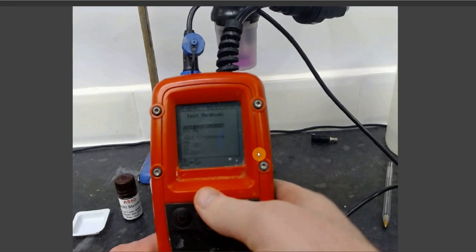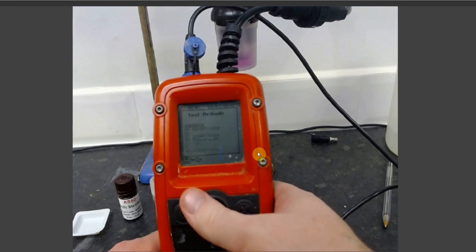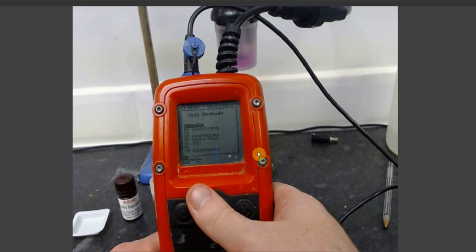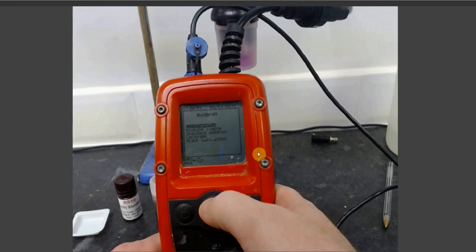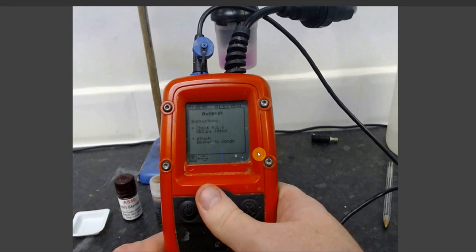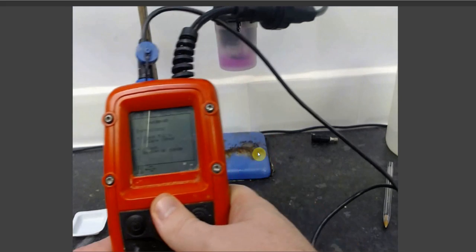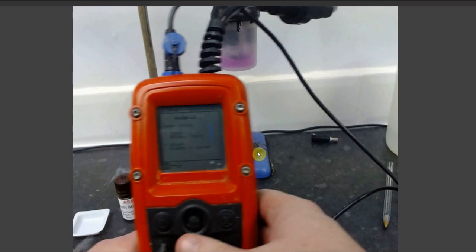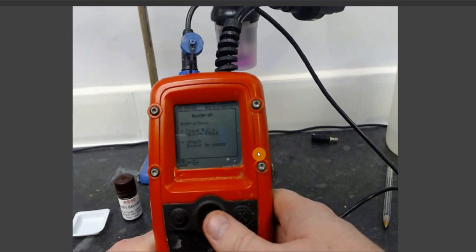Select Test Methods and scroll down to your Arsenic 3+5, also known as Arsenic Total, test parameter. Pressing select, you will be taken to a submenu where you will need to select Standard Addition. The Metalyser will prompt you to check your reference, counter and WE2 electrodes, which have been done in previous steps, and to attach the beaker to the sonde, which we have also done.